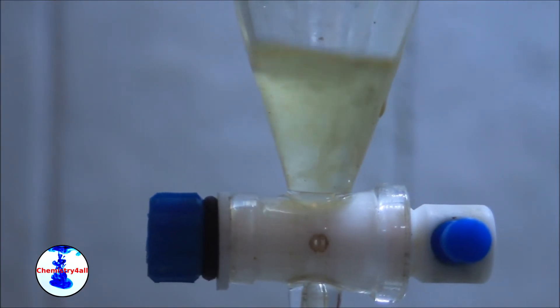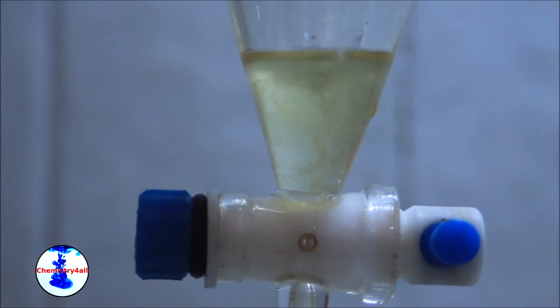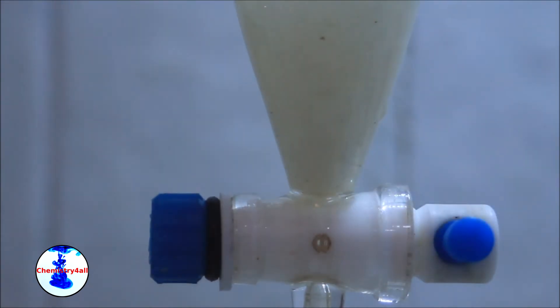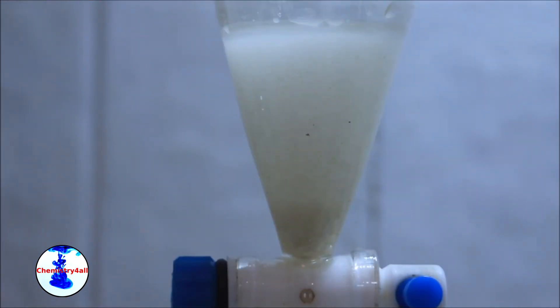The system is then allowed to cool down to room temperature. Finally, we just need to isolate our product from the crude reaction mixture. To do so, we add 20 milliliters of water to the reaction mixture and carry out two extractions using 20 milliliters of ethyl acetate each.